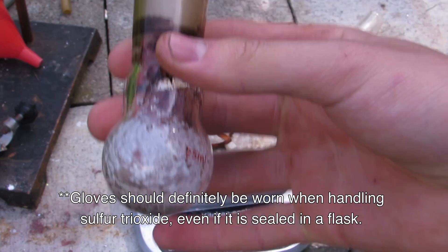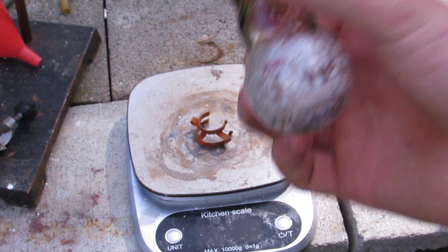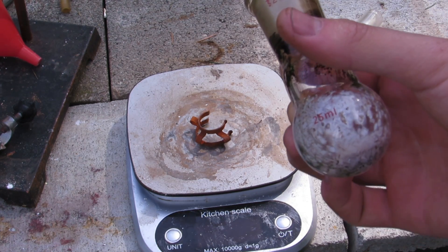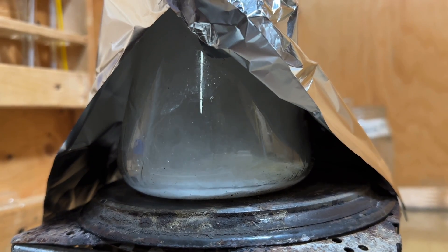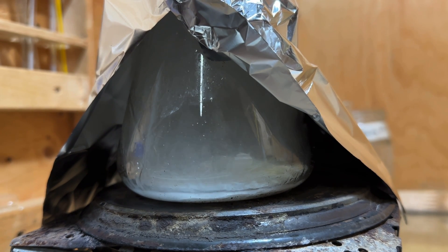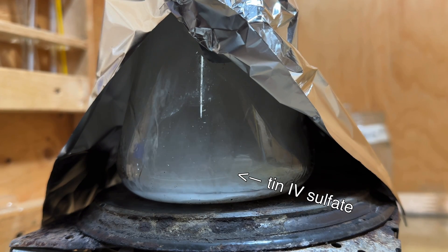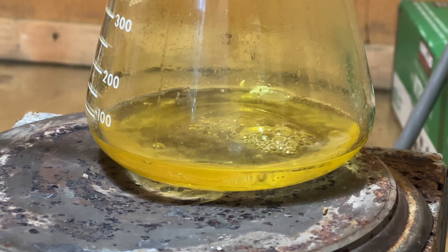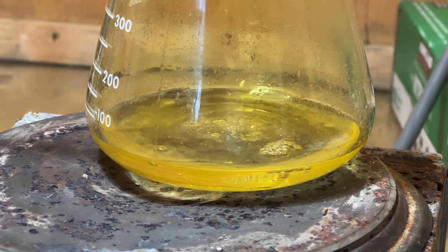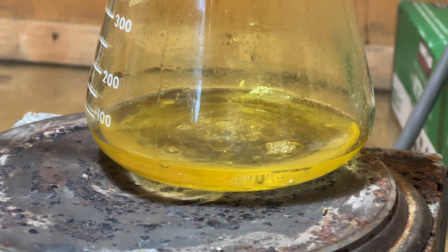Although I have had some success with producing sulfur trioxide through high-temperature decomposition of select sulfate compounds, more work is necessary to achieve an efficient setup. The method shown here utilizes the relatively low temperature decomposition of anhydrous tin(IV) sulfate to produce sulfur trioxide in ordinary borosilicate. Hydrated tin(IV) sulfate cannot be dehydrated by heating, however, so it is necessary to synthesize the anhydrous compound directly.